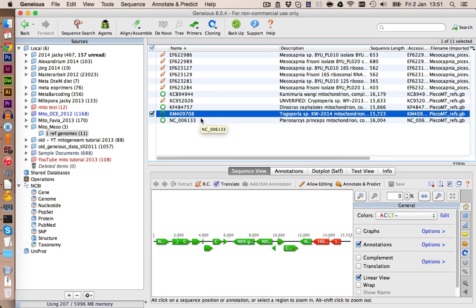I also included some single sequences which are from mitochondrial origin. Now we have to figure out which of those 4 mitochondrial genomes is the best reference genome to blast our hits against. We should pick one which has high similarity to our study organism. However, we don't have any sequences of our organism's mitochondria, so we're just going to use the one we have available.